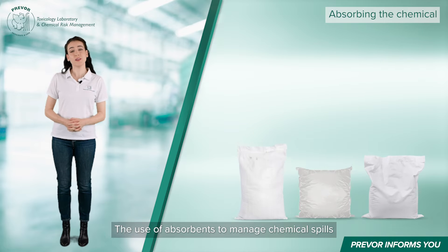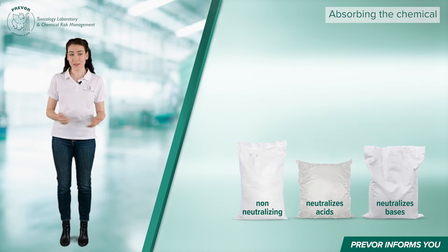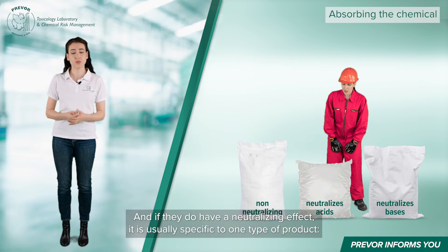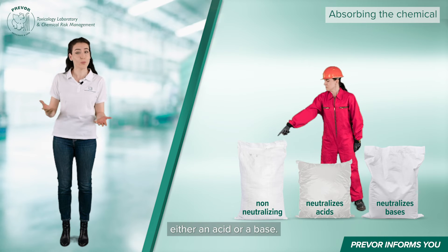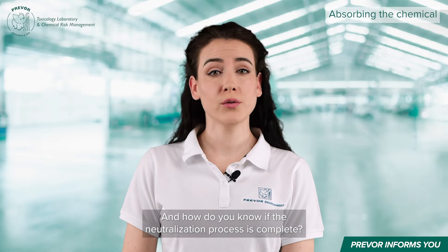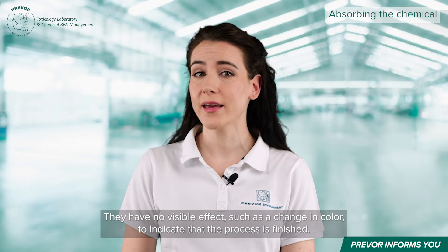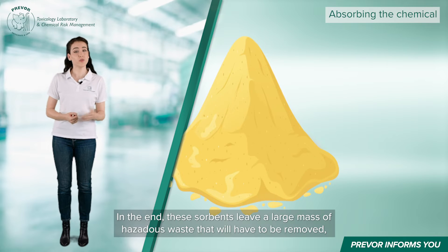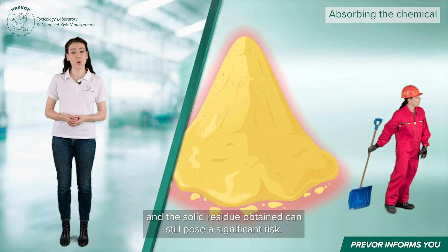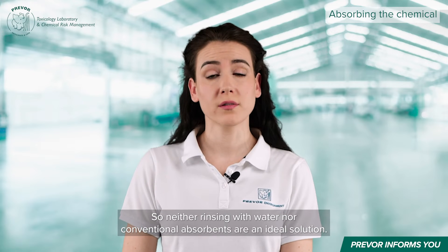The use of absorbents to manage chemical spills may also be an option. However, these absorbents do not always have a neutralizing effect. The chemical reaction may continue after they are applied. And if they do have a neutralizing effect, it is usually specific to one type of product — either an acid or a base. Therefore, you must be cautious when choosing the right product. And how do you know if the neutralization process is complete? They have no visible effect, such as a change in color, to indicate that the process is finished. In the end, these absorbents leave a large mass of hazardous waste that will have to be removed, and the solid residue obtained can still pose a significant risk. So neither rinsing with water nor conventional absorbents are an ideal solution.